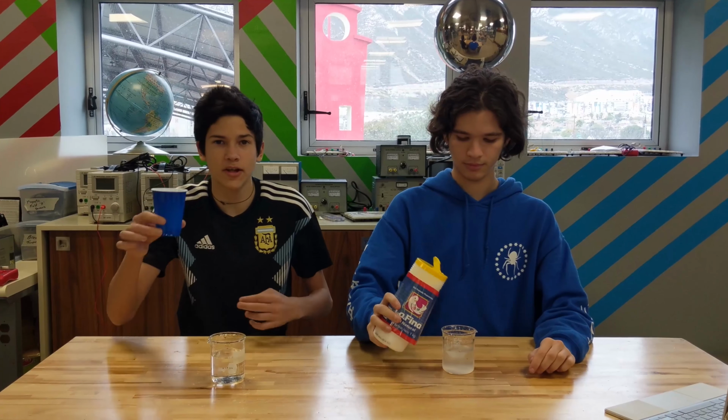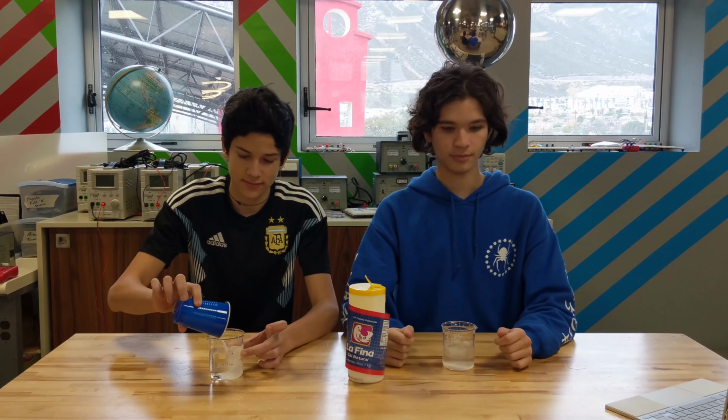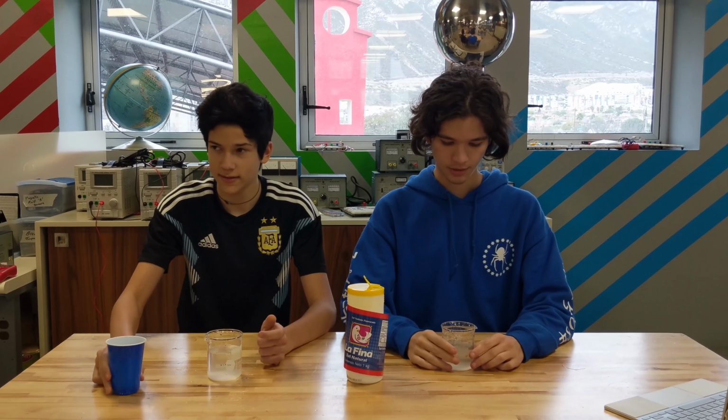The professor gave me salt A. I got salt B. I'm going to add 5 tablespoons of salt to the beaker and find out what happens. Doing the same with salt B. Oh my, this flask is cold. Whoa, this one's hot! Let's ask our professor why that is.